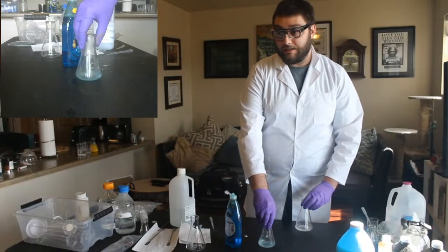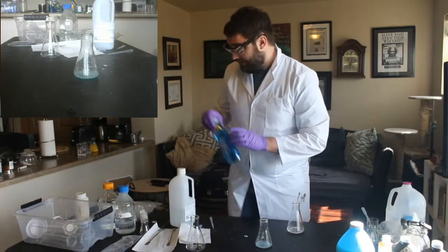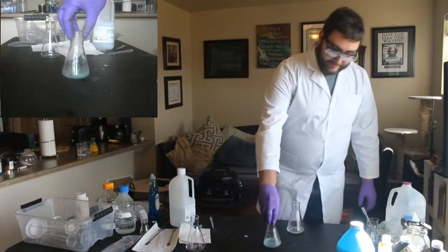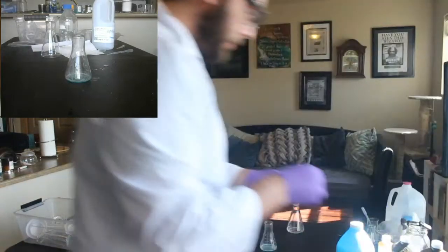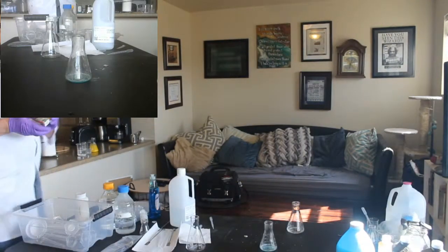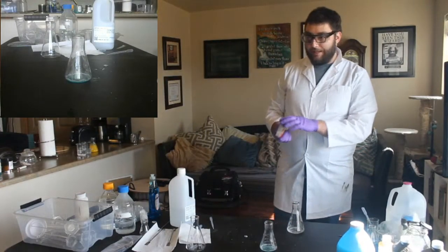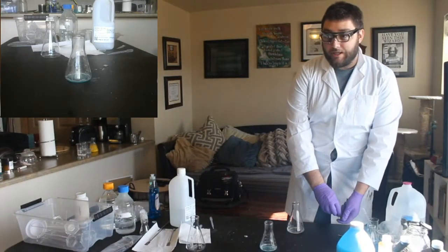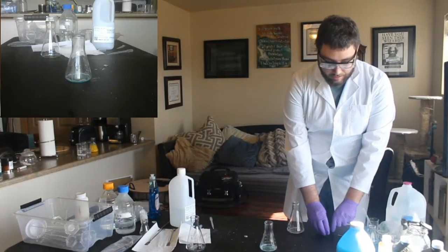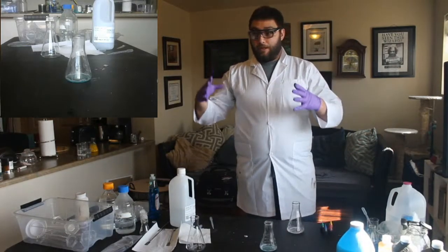I wasn't planning on doing this today, but we have extra time, so let's make a mess. So now we have that soap, and I'm going to go grab my colors. Here they are. So what color do we want this to be? Again, remember, because we generated so many bubbles, this soap is going to trap all of that oxygen and make a bunch of bubbles really quickly.